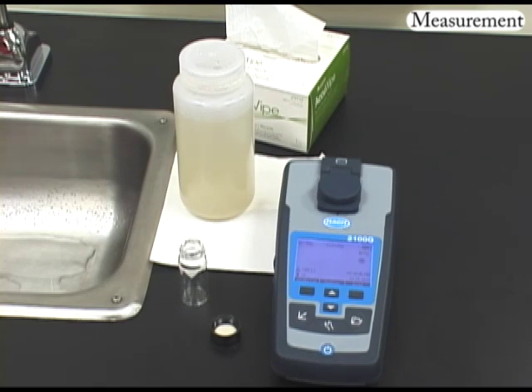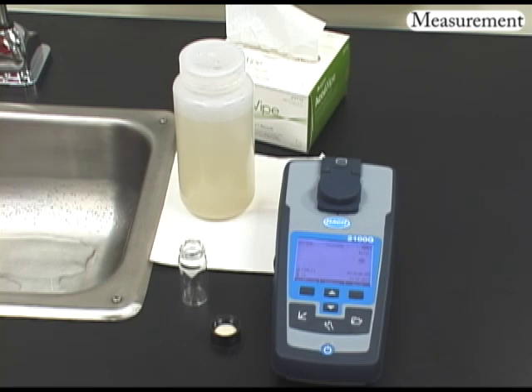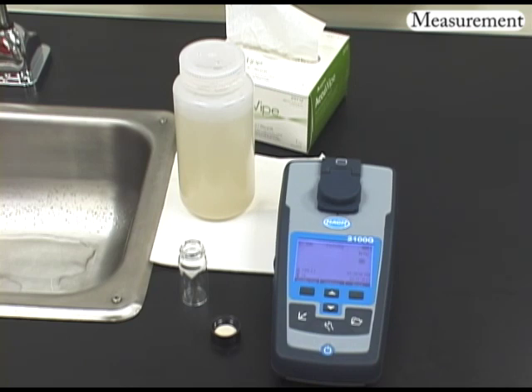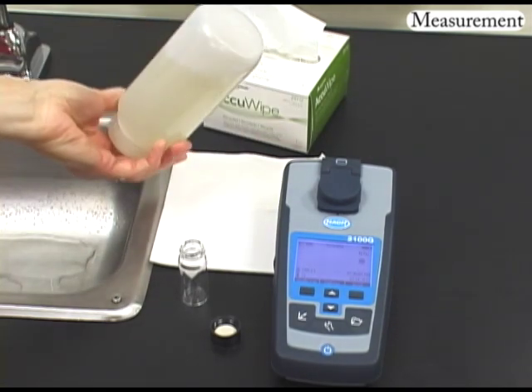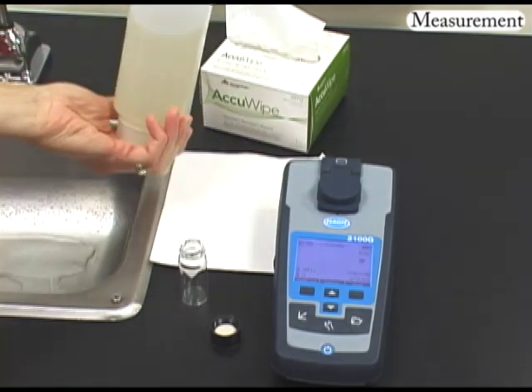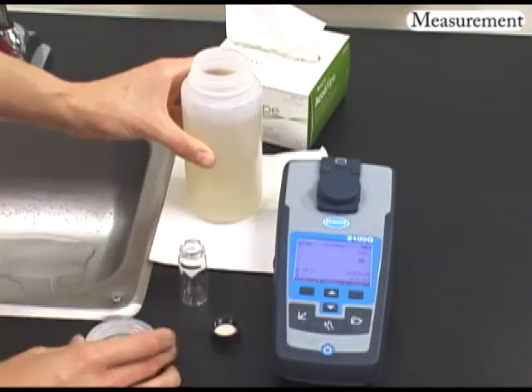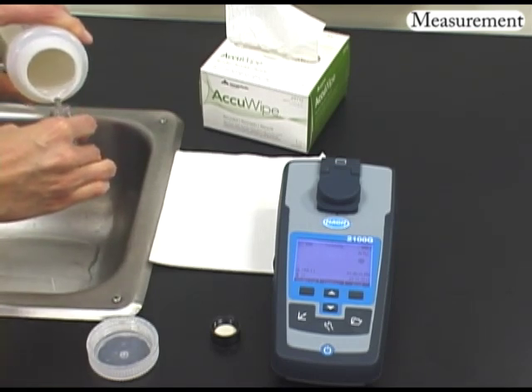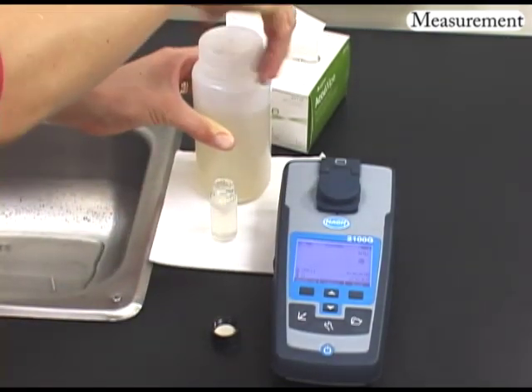Samples should be collected in plastic or glass bottles. All bottles must be thoroughly cleaned, rinsed with turbidity-free water, and dried prior to use. Volume collected should be sufficient to ensure a representative sample, allow for replicate analysis if required, and minimize waste disposal. Before pouring the sample into a sample cell, invert the sample bottle several times to ensure a homogenous mixture. Do not shake the sample to mix, as this may introduce bubbles into the sample. Immediately after mixing, fill the sample cell, then dump to waste. Repeat this a second time, then fill the sample cell a third time, being careful not to introduce air bubbles, and screw on the cap.